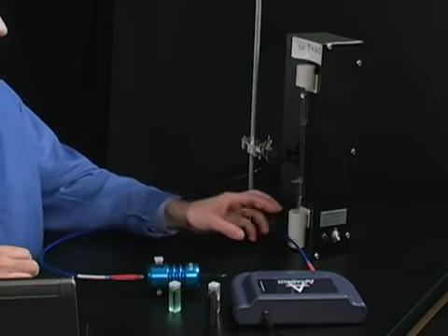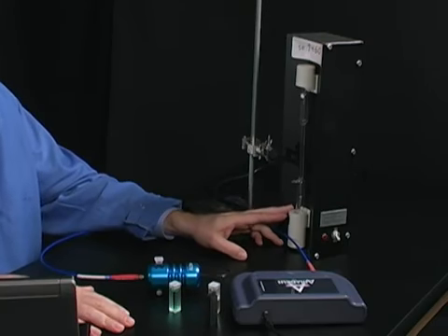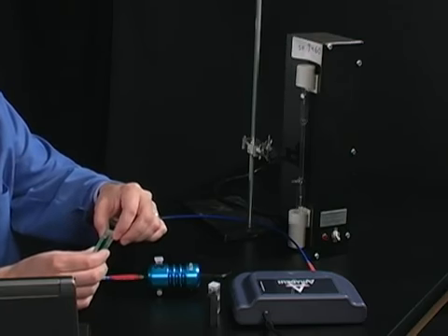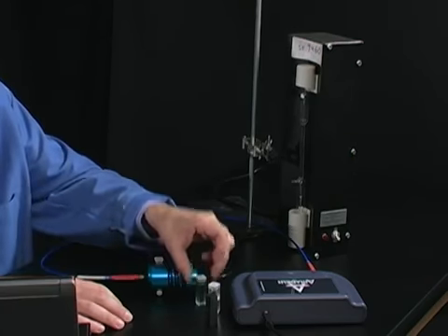Right. So we can use our spectrometer as a way to study emission spectrum and relate that to structures of atoms. And we can also look at solutions and measure the relationship between light and matter. Why does this appear the color that it appears? And the spectrometer allows us to do that and allows us to quantify that information.